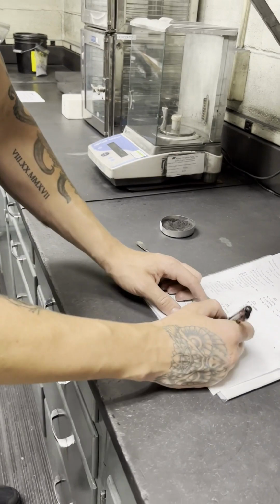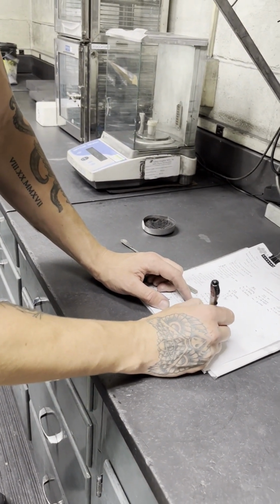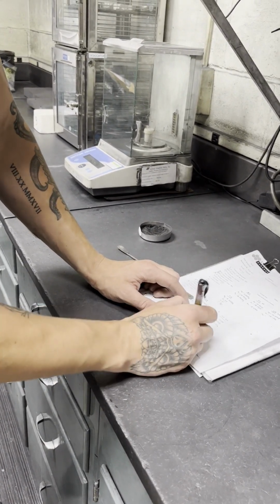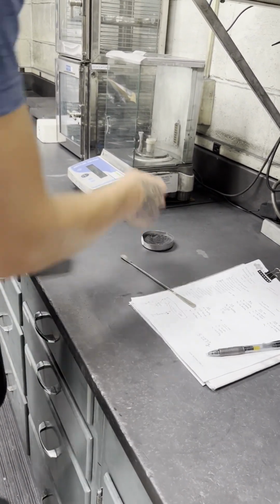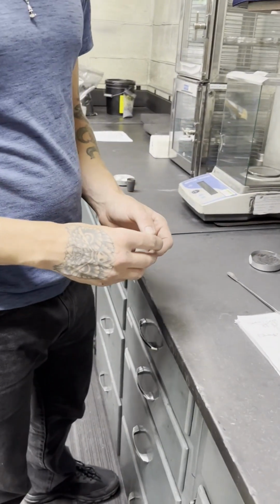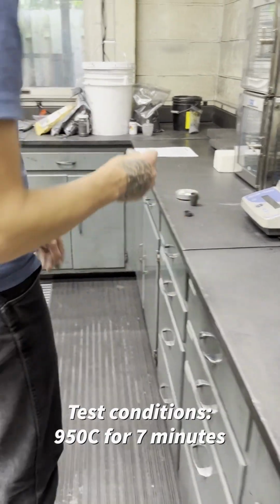This is our original sample weight, and this is always done on dried basis. So this material should have been previously dried prior to performing this volatile test. Okay, we have that weight down. So now we can put the volatile in the furnace for 7 minutes at 950 degrees Celsius.